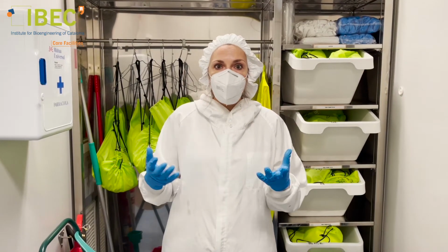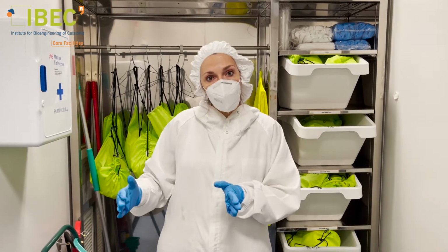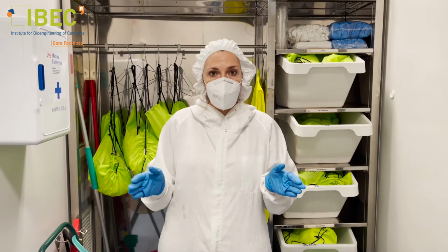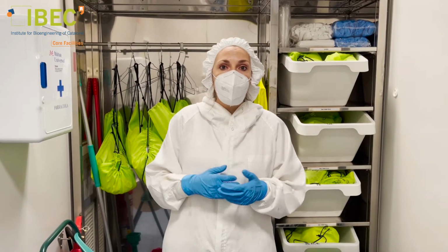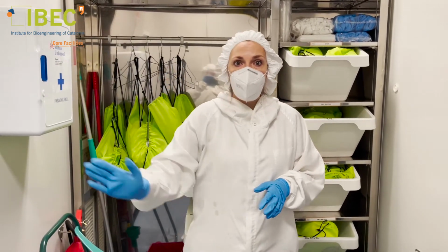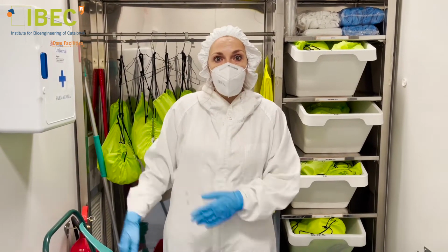The other conditions such as temperature, humidity, and pressure are constantly monitored to assure this uniformity of conditions during the fabrication of our researchers. For instance, the temperature is always kept in a range between 20 and 22 Celsius degrees, and the relative humidity is always kept between 45 and 55%. There is also a slight overpressure that drives all the contaminants to the exit and keeps renewing the air inside the room. Now, let's see how our Cleanroom is.